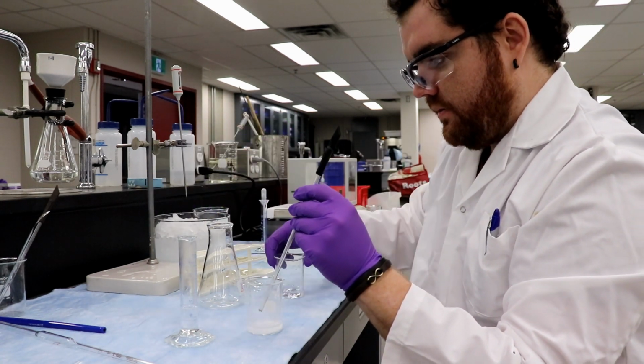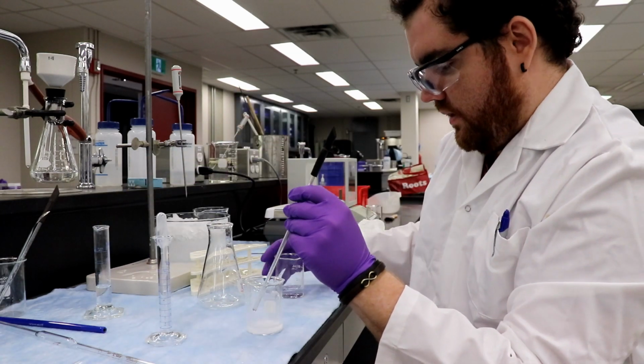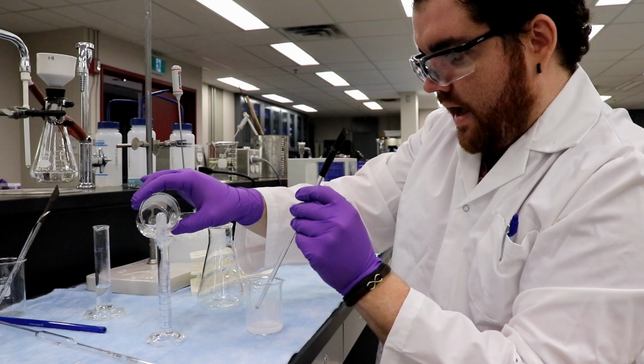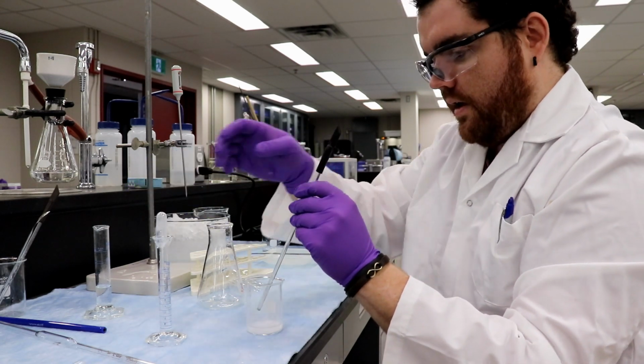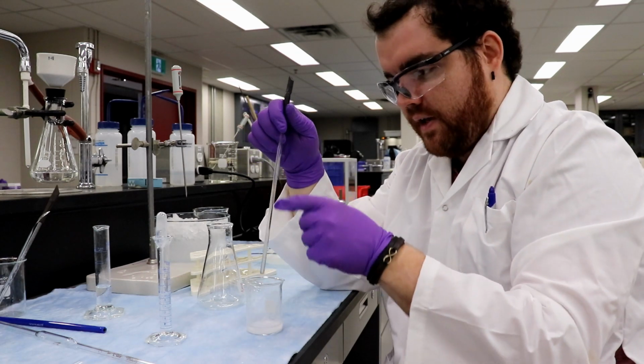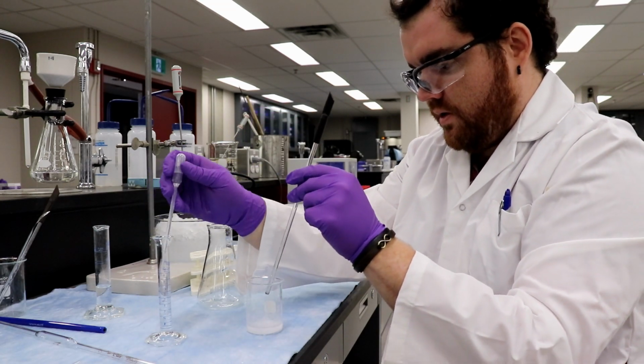Oh, that's the wrong... There we are. Because as I'm doing all this crushing... Ooh, that's hot. I have a lot of product stuck on the glass bar right here. So I want to take a few more mils.